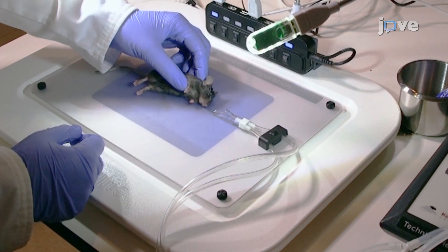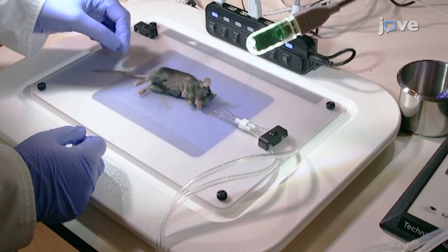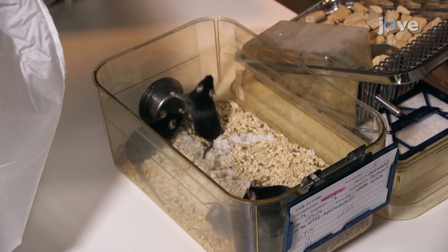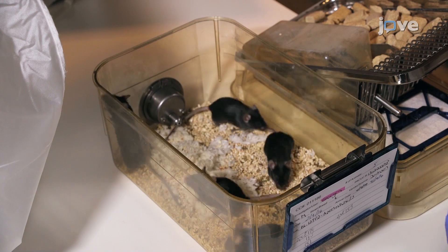Turn the anesthetic concentration dial to minimum to deliver 0% and remove the animal from the nose cone. Monitor the mouse closely during anesthesia recovery. Once the mouse is fully ambulatory, return it to the cage.